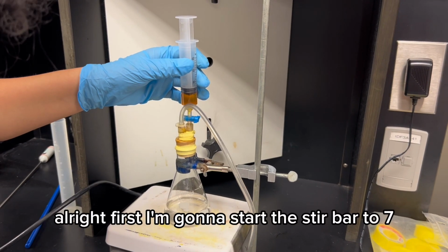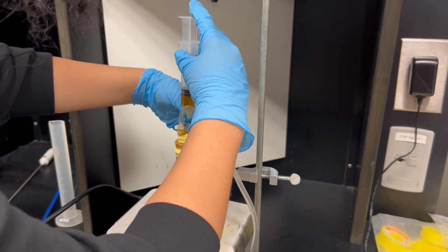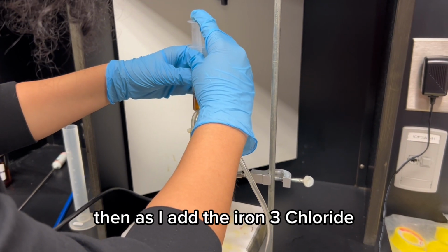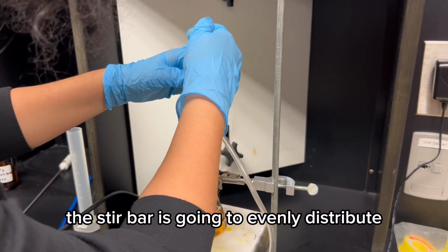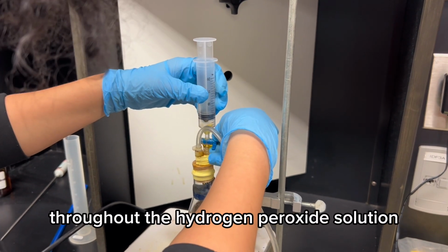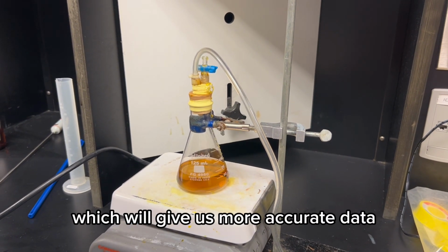First, I'm going to start the stir bar at 7, and then as I add the iron 3 chloride, the stir bar is going to evenly distribute it throughout the hydrogen peroxide solution, which will give us more accurate data.